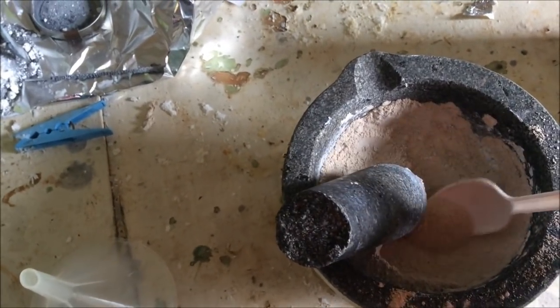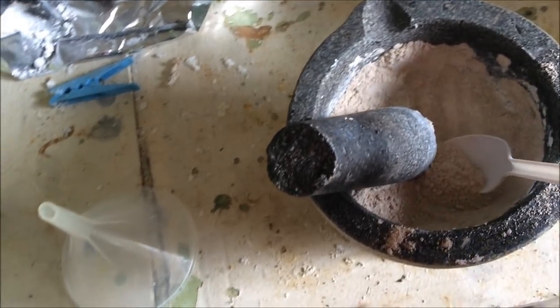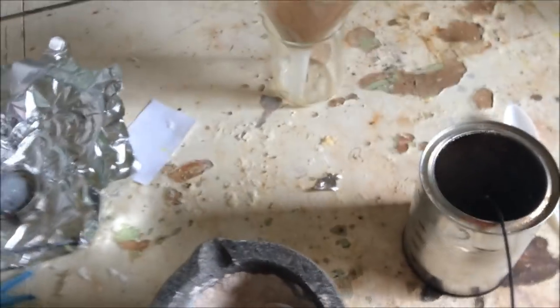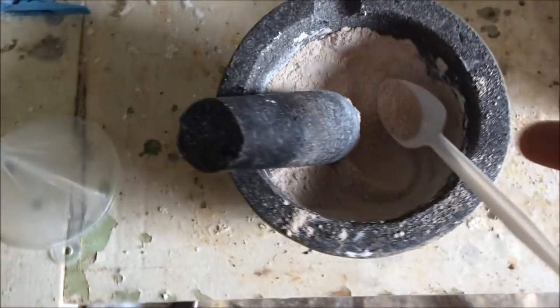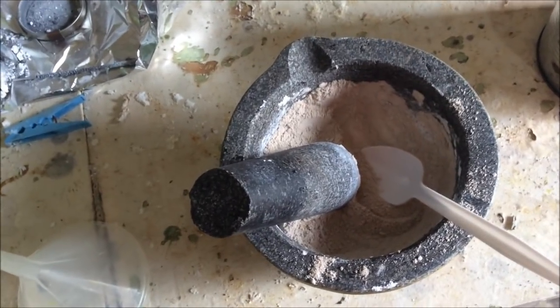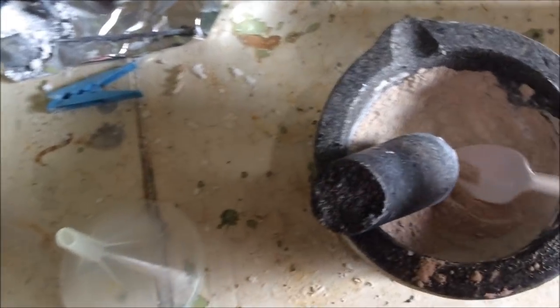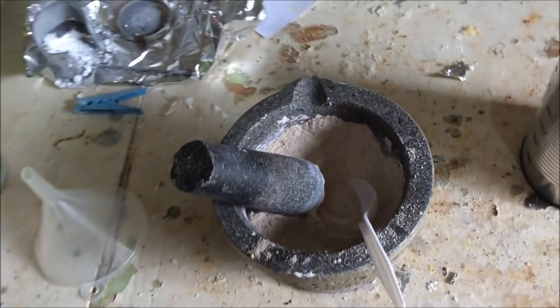Okay, so I've ground up the sodium terephthalate. It's brown now, but hopefully all those important benzene rings are still intact. Annoyingly, because I left some sodium hydroxide in there because I didn't filter it properly and wash it like you should do if you're doing this project, because I tried to do a shortcut, this brown powder is hygroscopic. I went to grind it the other day, thought it was dry, and it was all lumped together, just this brown clay. So I had to re-dry it and then grind it, and it's already pulling moisture from the air, which on a day like today is easy, seeing as the lab flooded and it's currently raining, and will continue to rain for a few days.